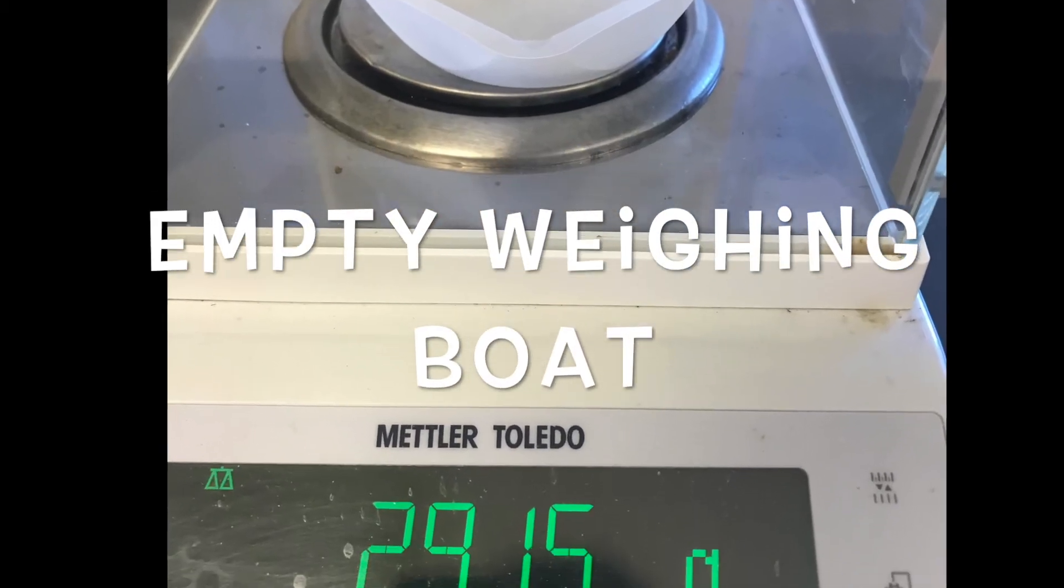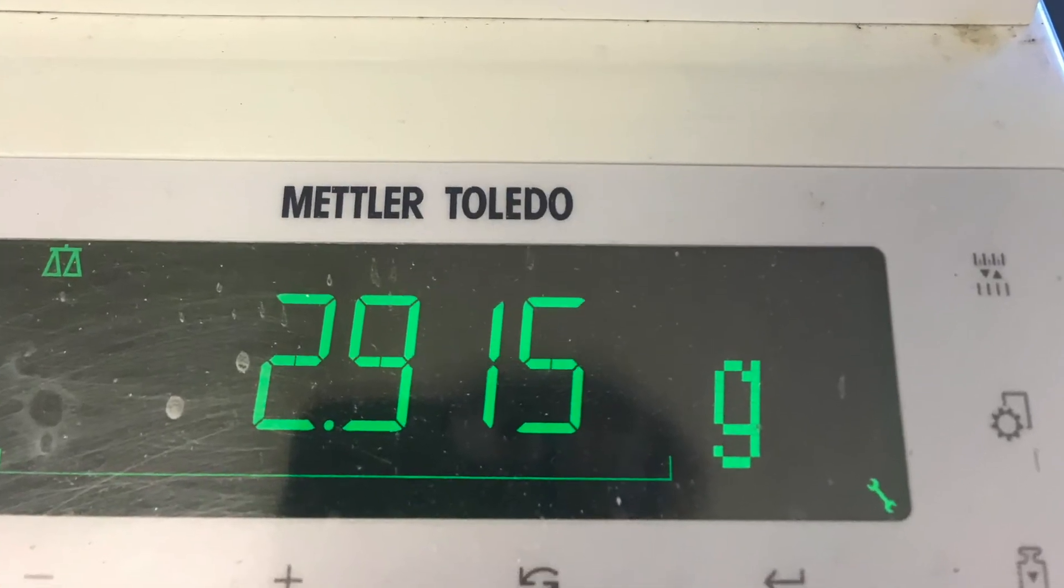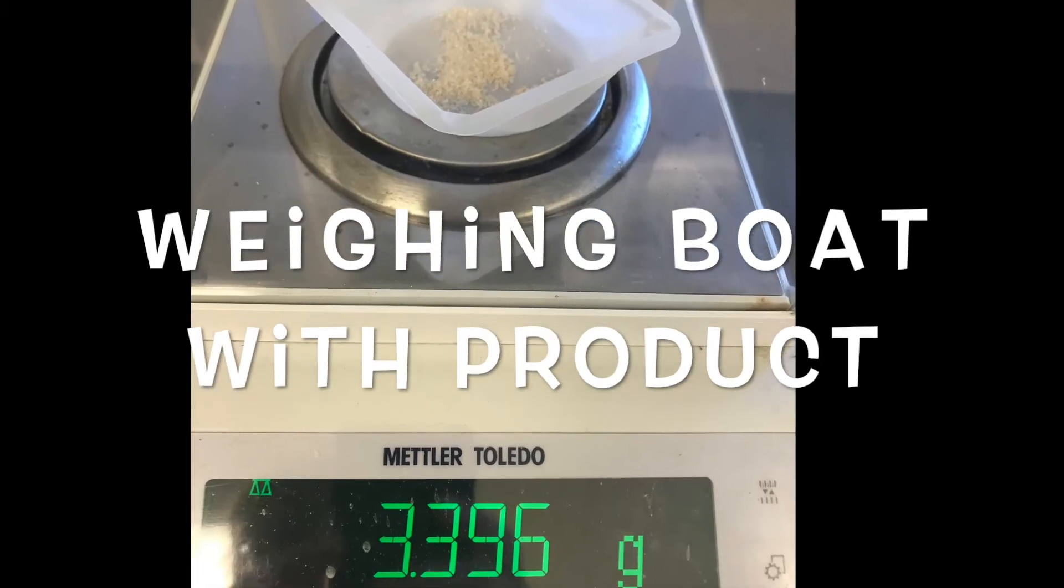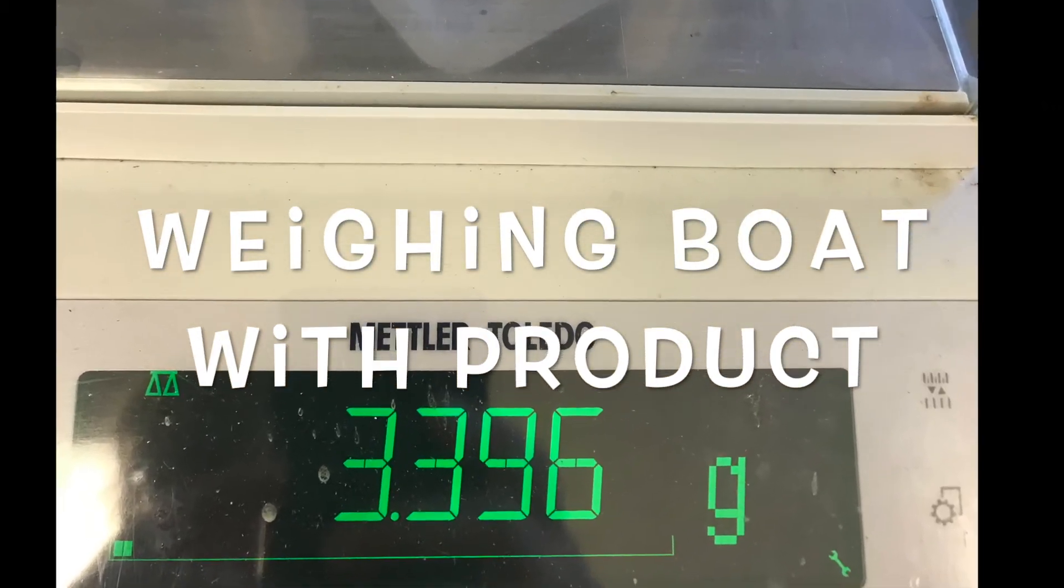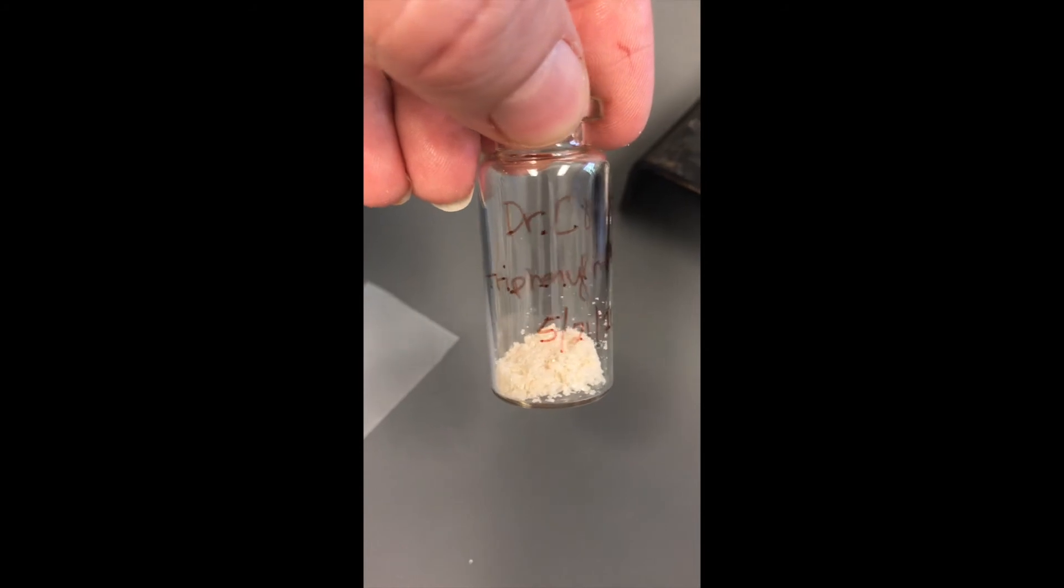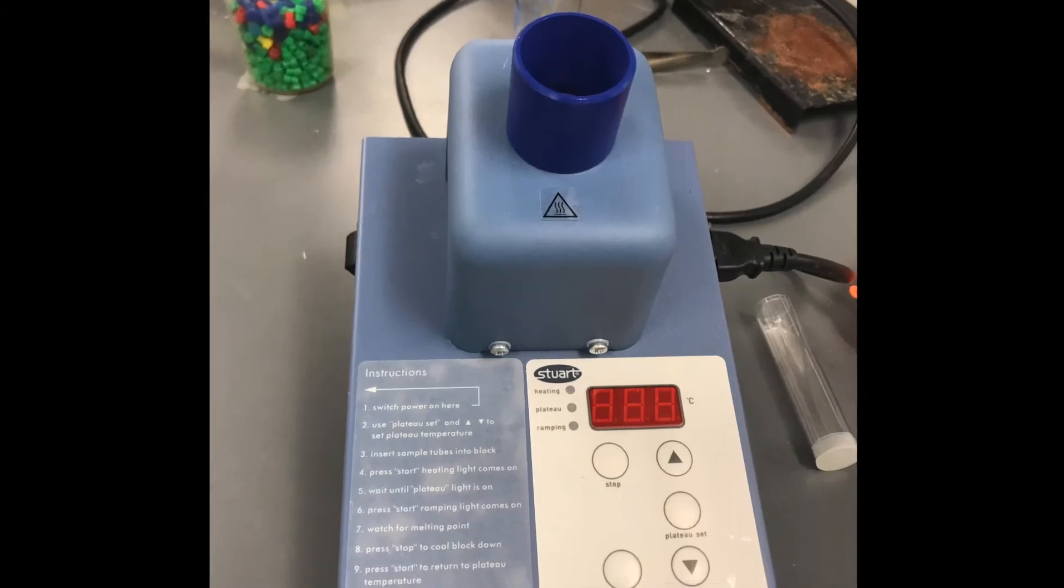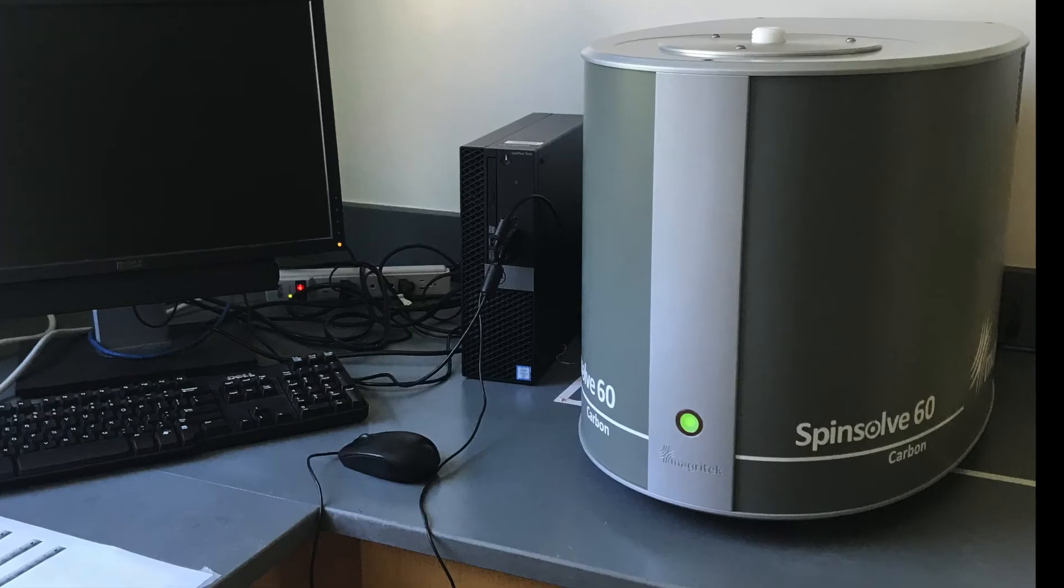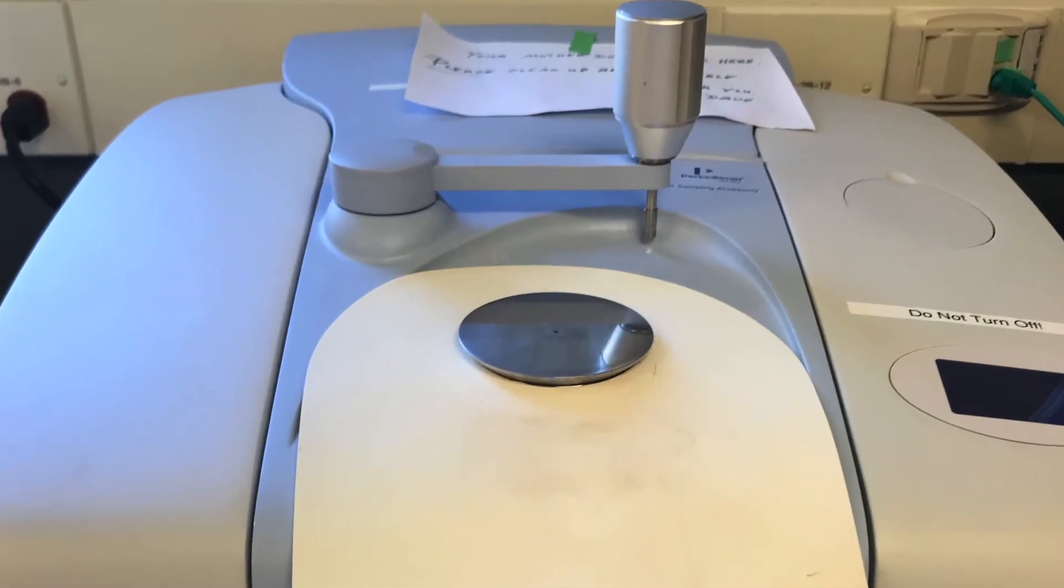I transferred these dried crystals into a pre-weighed weighing boat. Finally, I transferred my final product into a sample vial for subsequent melting point, NMR, and IR analysis.